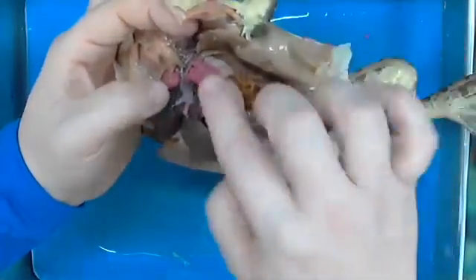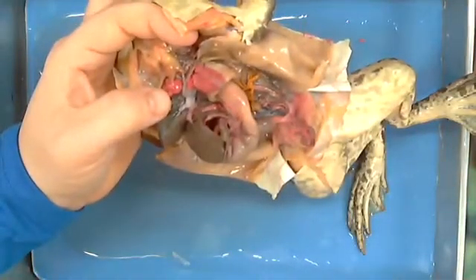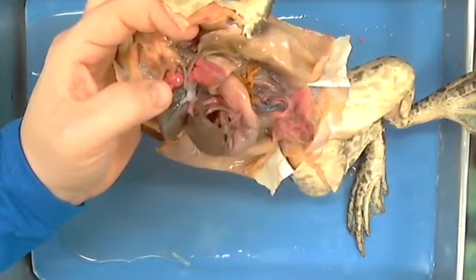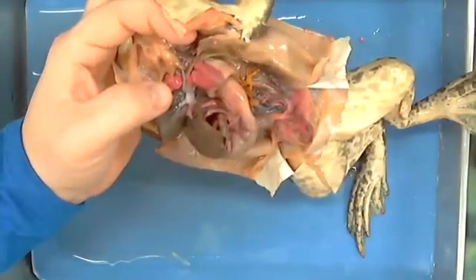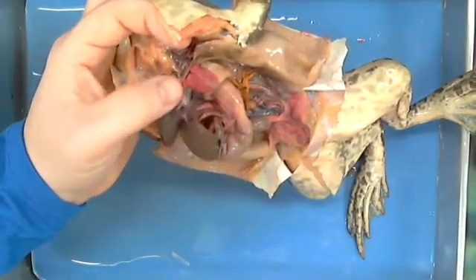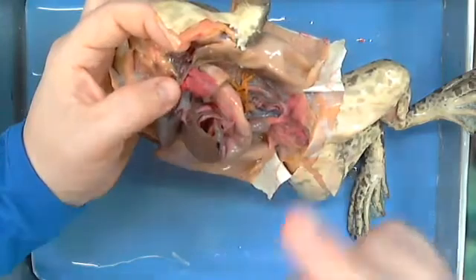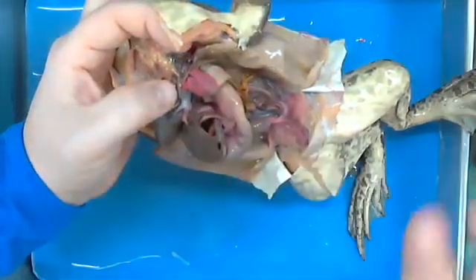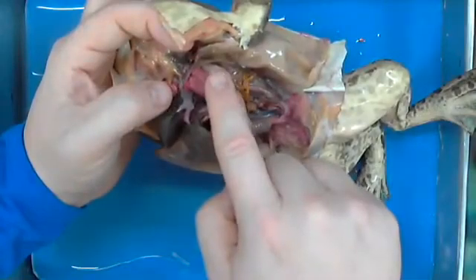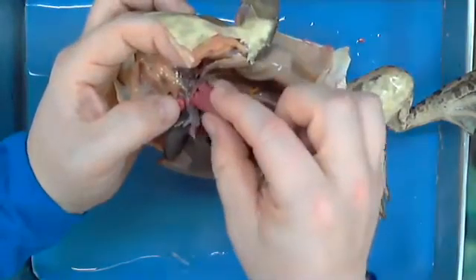This is also very filled with blood, because what happens in the lung? Breathing. Right. Well, be specific. What happens in the lungs dealing with blood vessels? What goes in? Oxygen, and release of carbon dioxide. There we go. So we're losing carbon dioxide and taking in oxygen. So there are lots and lots of blood vessels in our lungs. You can kind of see that in this case right here.